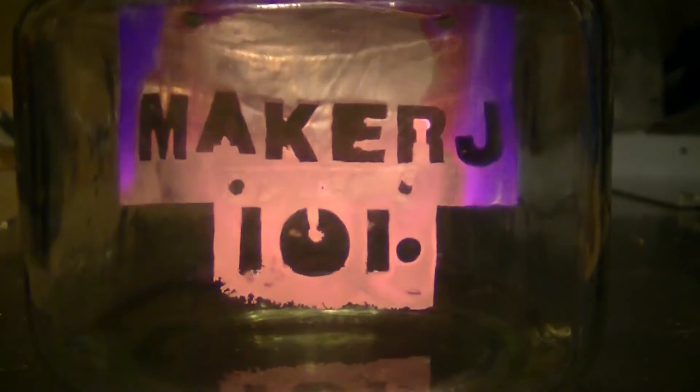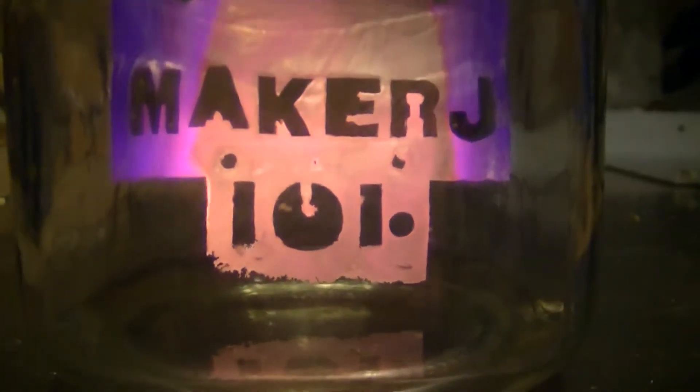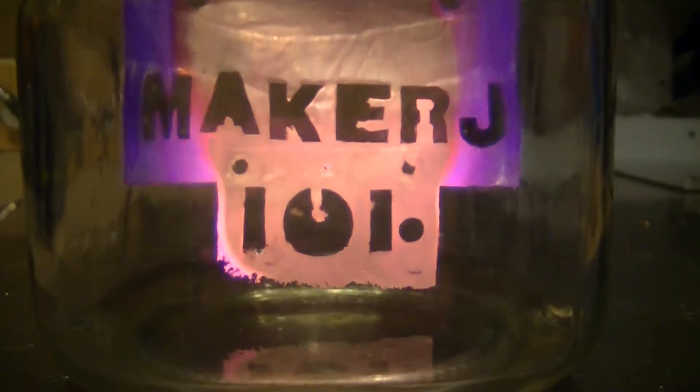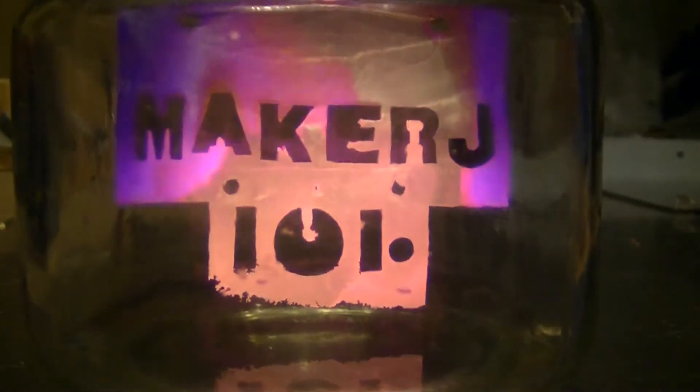Hello, this is MakerJ101, and here's a cool little experiment that kind of sort of involves fire, more so it involves catalyst. I'll get to that in a second.